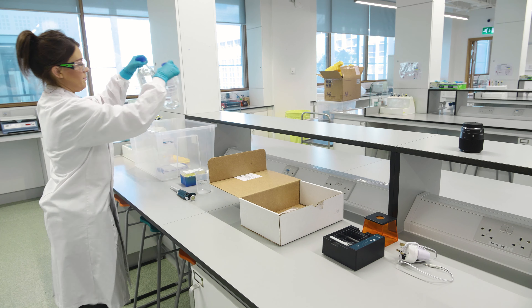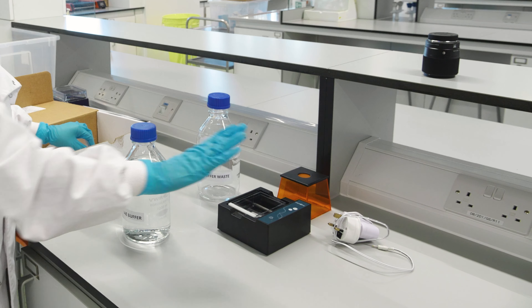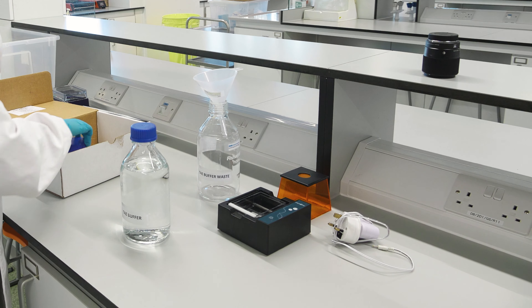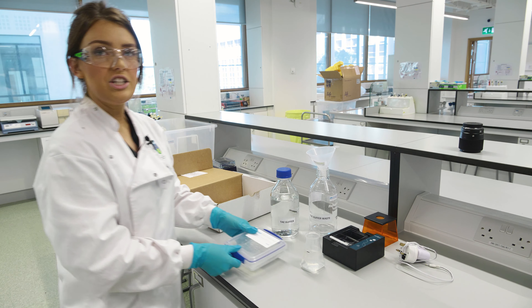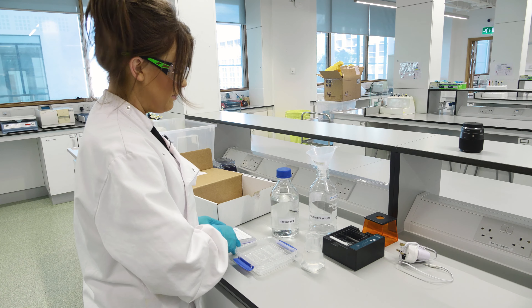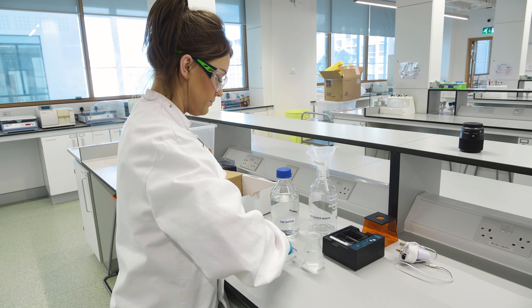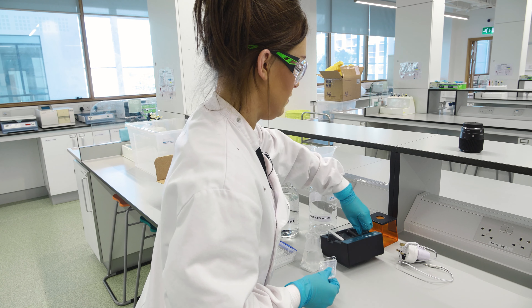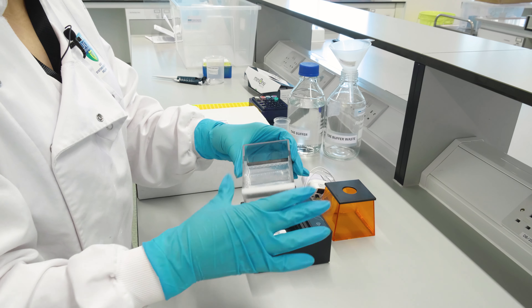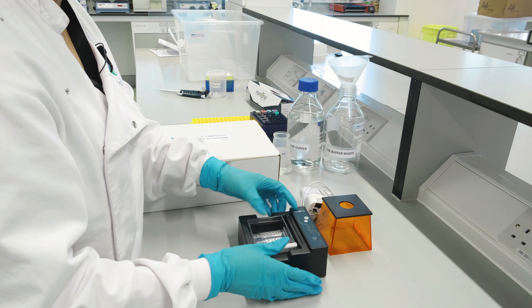You'll also give them their TAE buffer and their buffer waste container. When you're finished with the TAE buffer in the mini one, put the funnel in the waste beaker and use it at the end. The gels have been stored in the fridge since you got the kit — you can take them out. They're left in their gel trays which slot into the mini one apparatus on the sides; you should hear a little click when they go in. Make sure you match the plus and the minus to the inside of the mini one tank.